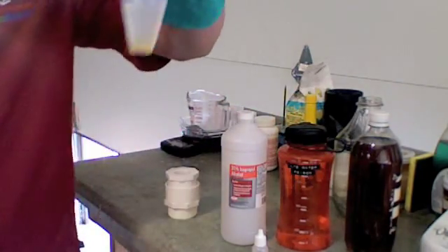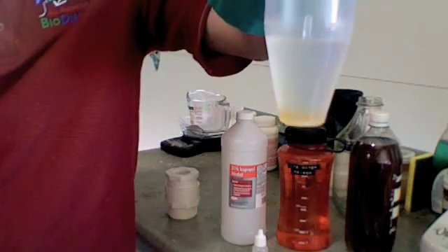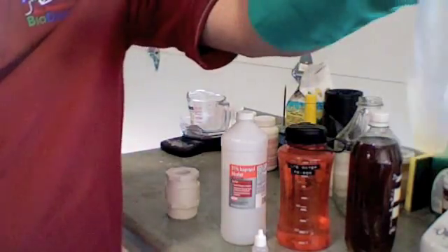Notice, your waste vegetable oil will be separated to the bottom. That's alright as long as you swirl.